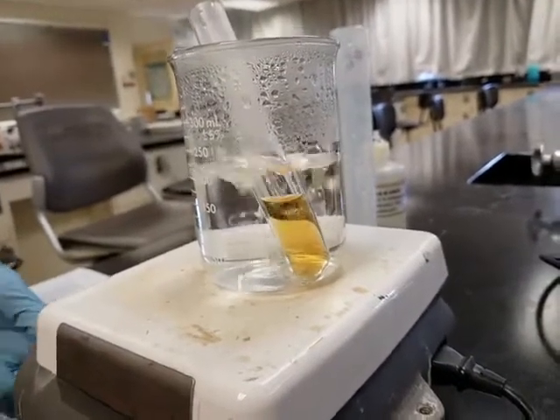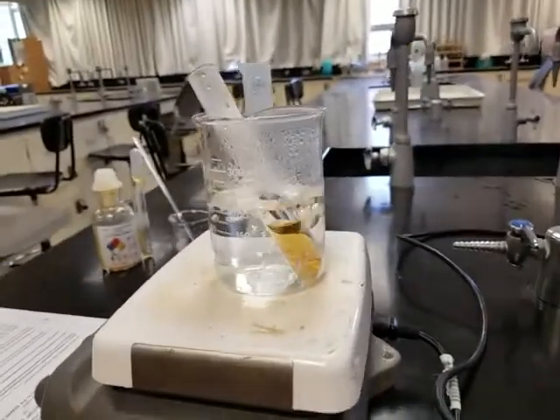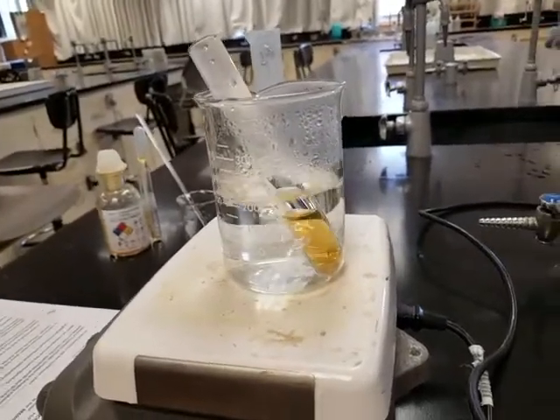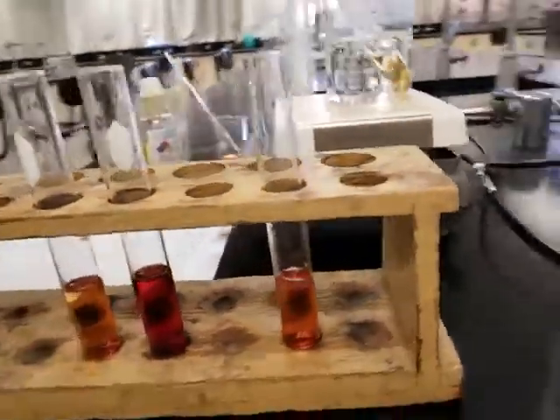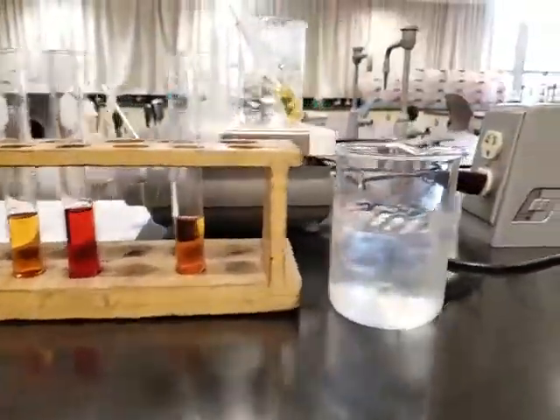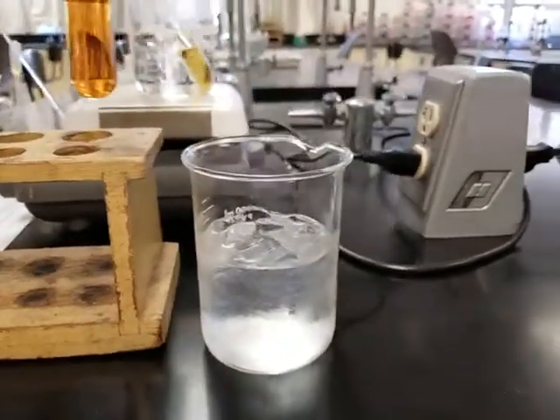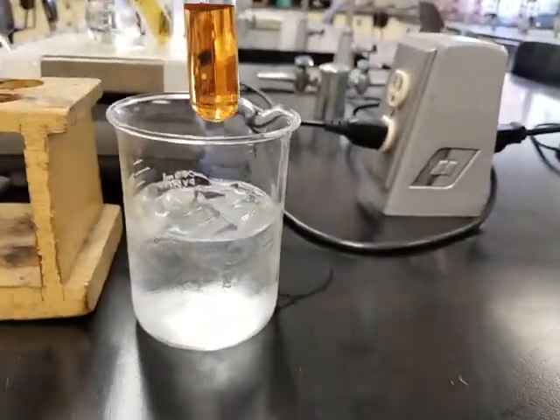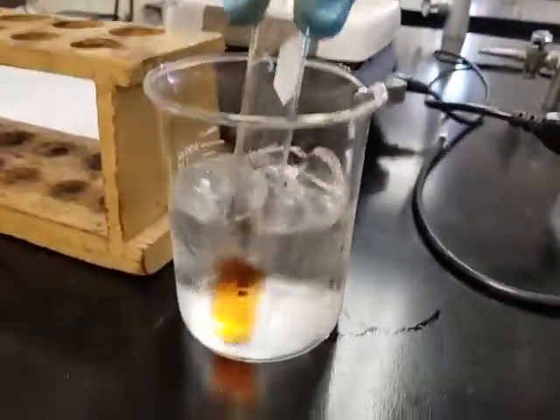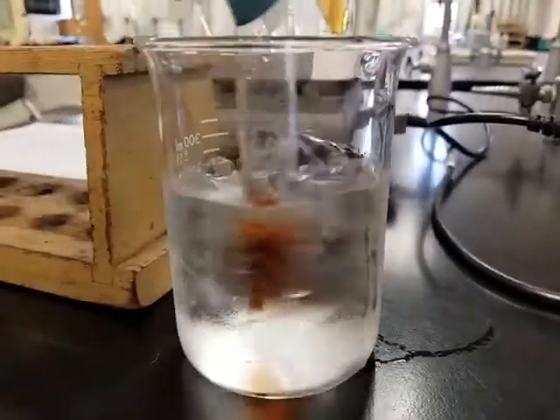We're going to continue to let that run, and you're going to turn off the heat. As indicated, step 4 is turn off the heat because you already made your observations. Step 5, place the 4th tube. Now we're going to take the 4th tube and place it into a mixture of ice and water. We heated the last one up, so we're going to cool this one down and make our observations. You ready? Okay, let's go ahead and cool it down. Now it's really cold.